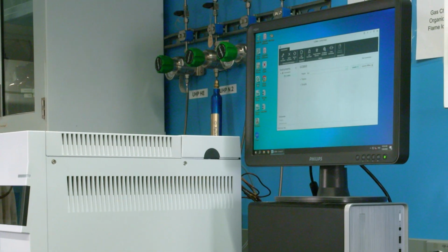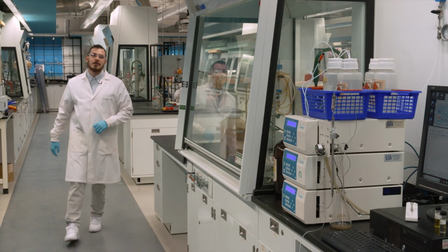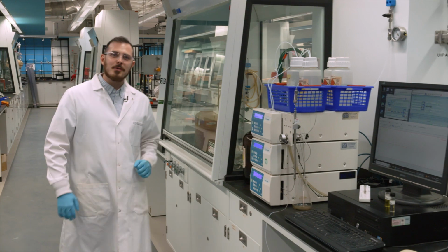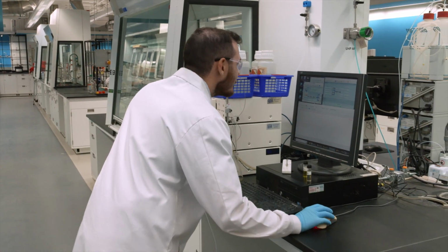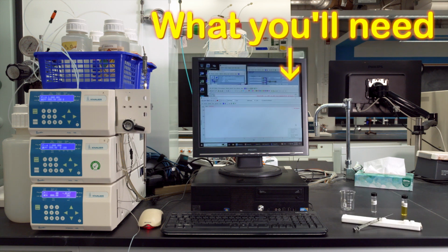In this course, gas and liquid chromatography are mentioned a lot when it comes to sample analysis. Seasoned researchers understand their use and importance, and if you aspire to be an analytical chemist, you should too. In this video, we'll be covering tips that will be applicable to experiments 5 and 6.